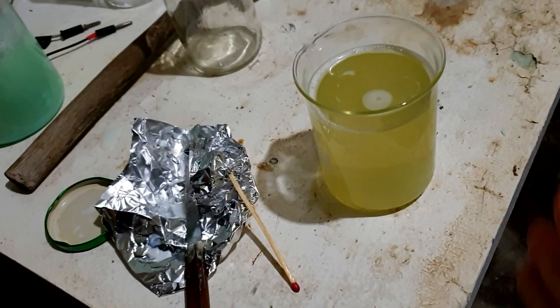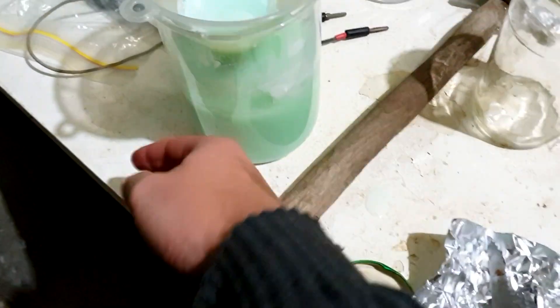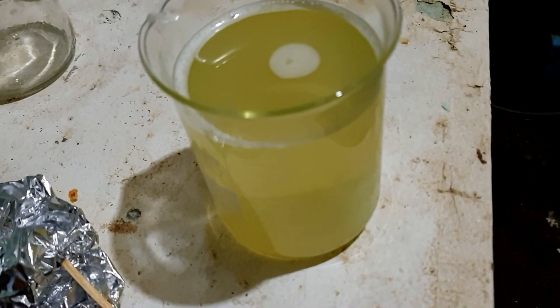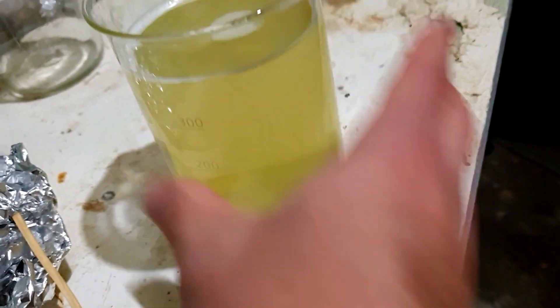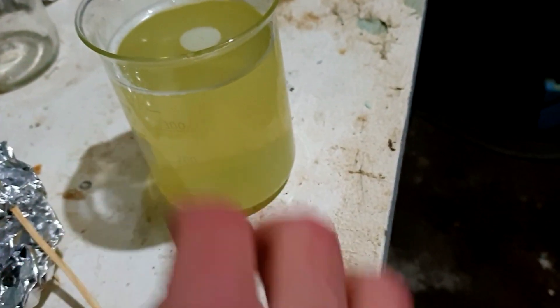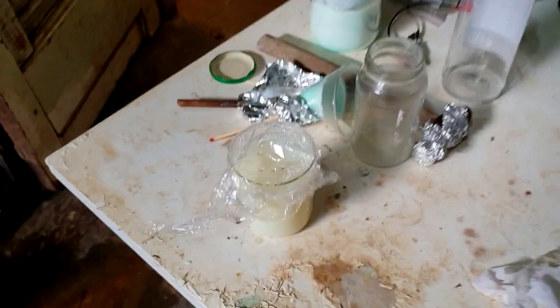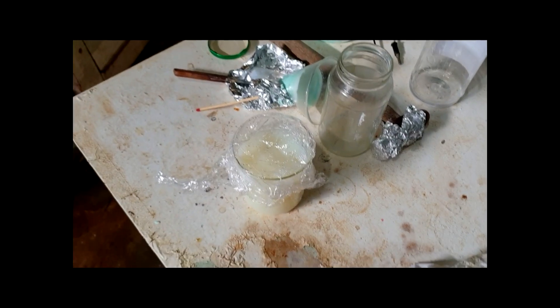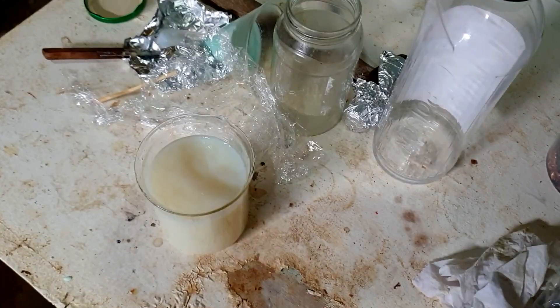Alright, it's looking very yellow — typical yellow chemistry — but there's a whole lot here. I can't be bothered hot filtering anymore, so once everything cools down we should see quite a bit of precipitate, but hopefully it doesn't go into a big bar of soap again. You want that nice compromise between lots of product crashing out but still being able to get the solvent off it. Alright, everything's cooled down and — what do you know — everything's set into one giant block again. Bloody hell, this is getting a bit frustrating. I'm just going to have to try and filter this. Too much product.